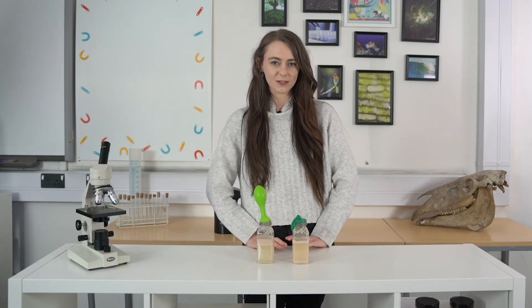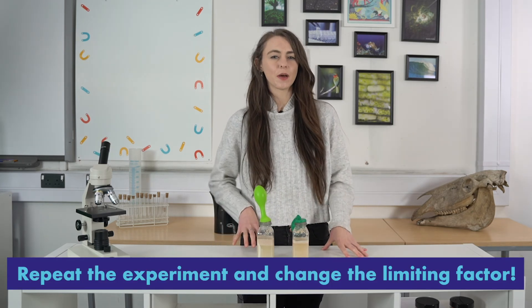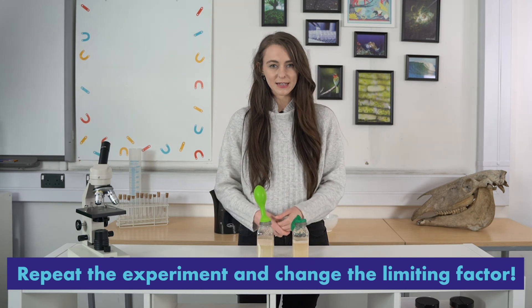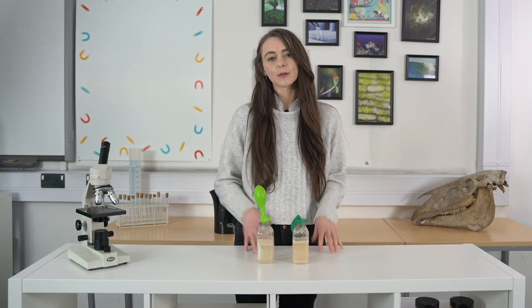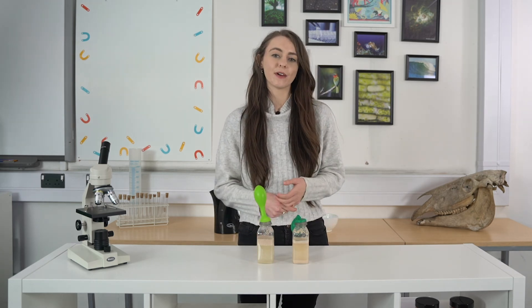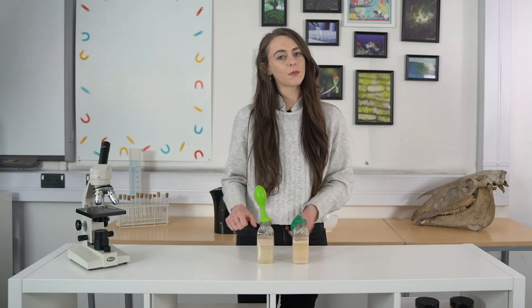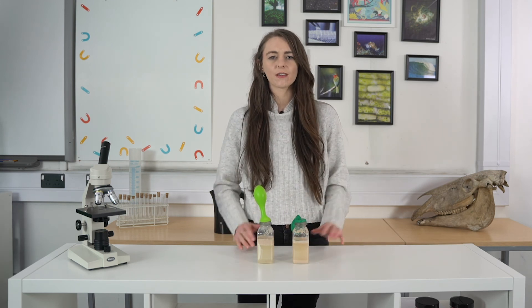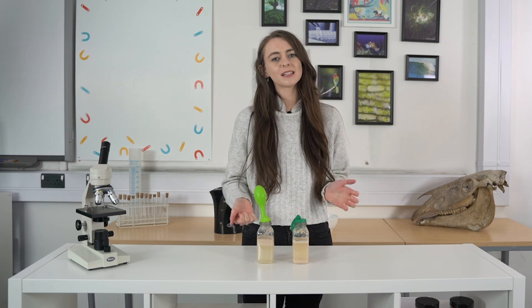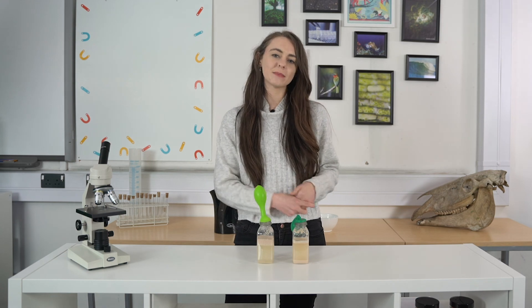Why not try this at home using your S4 Science delivery box? Play around with your setup as well — different things can be limiting factors. You can use sugar as a limiting factor, but also environmental conditions can be a limiting factor. Why not try putting sugar in both bottles, but one in a water bath and one not, and see how temperature affects the rate of reaction. See what else you can think of. If you do try it at home, reach out to us on social media and show us your photos. I hope you have enjoyed learning about limiting factors and the rate of reactions. Bye!